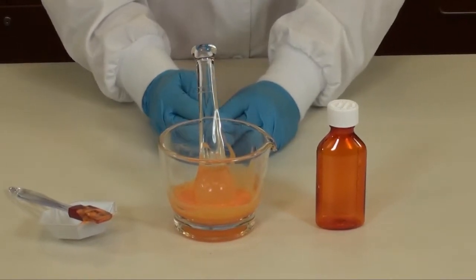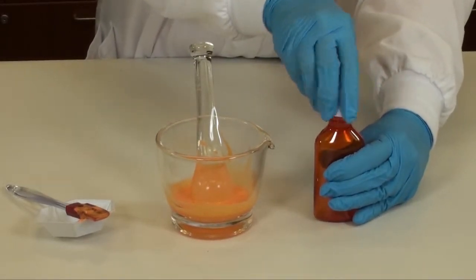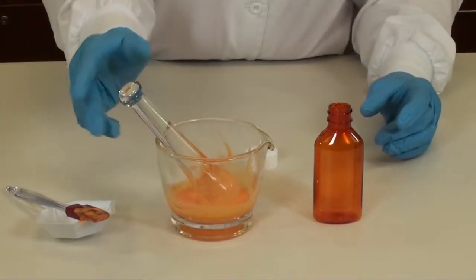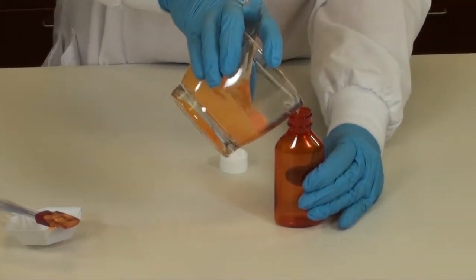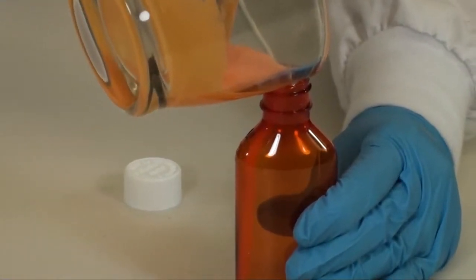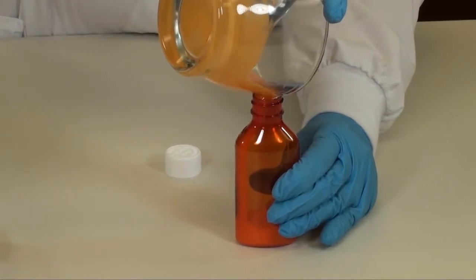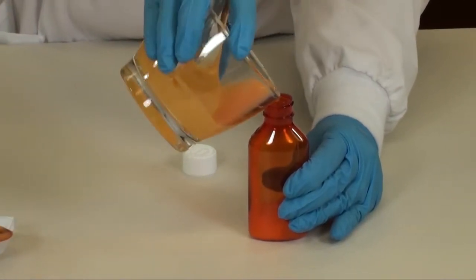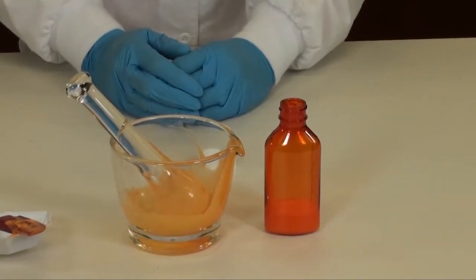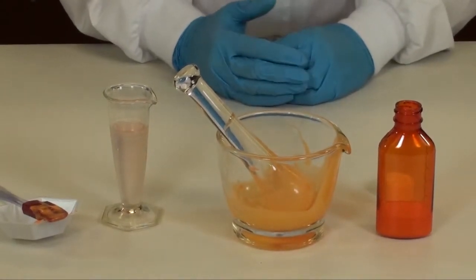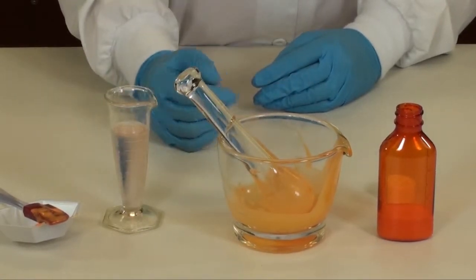Pour the allopurinol hydrochlorothiazide and ORA Plus into your prescription bottle. You can hold the pestle with one finger while you pour the product.